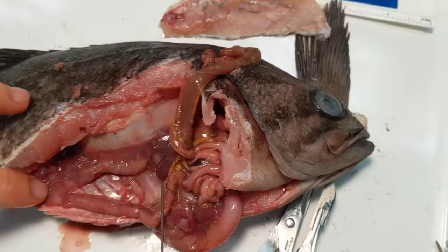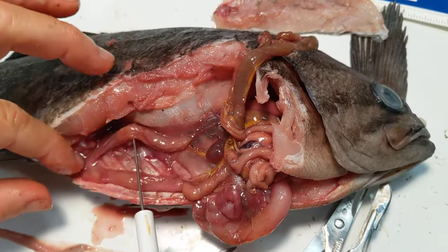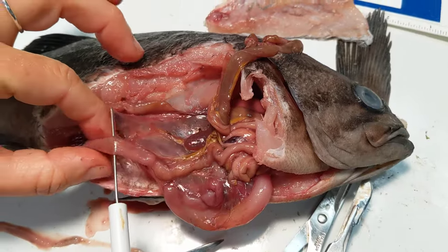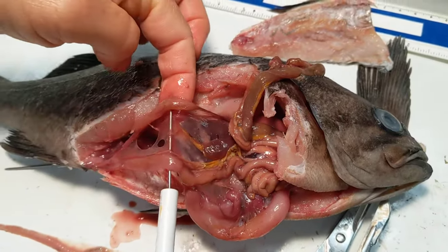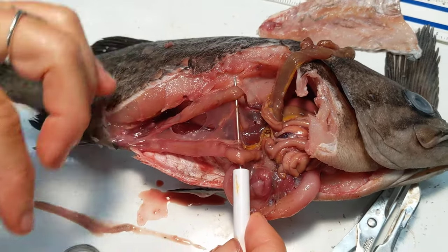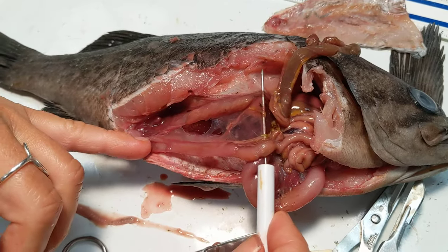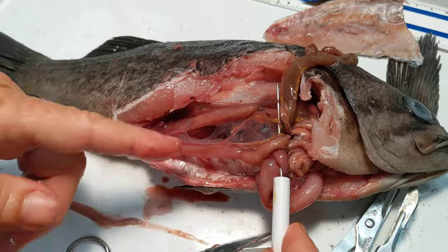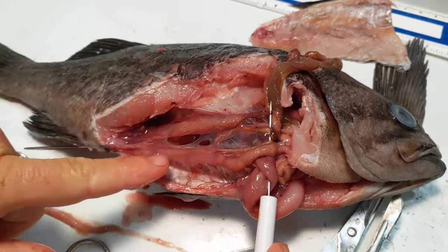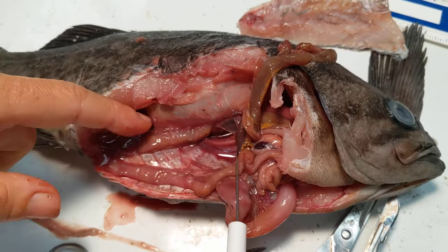Now what we can see laying out here are two lobes — these are the gonads. A way to tell a male from a female fish is that usually the males' gonads, the testes, will be white and narrow. The females tend to be more pink and rounded. So this is a female. She is not gravid, but she's getting there — she's mature. I can see that by the fullness of her gonads. They could be quite large when she's ready to start breeding, and you'll see the eggs within there.